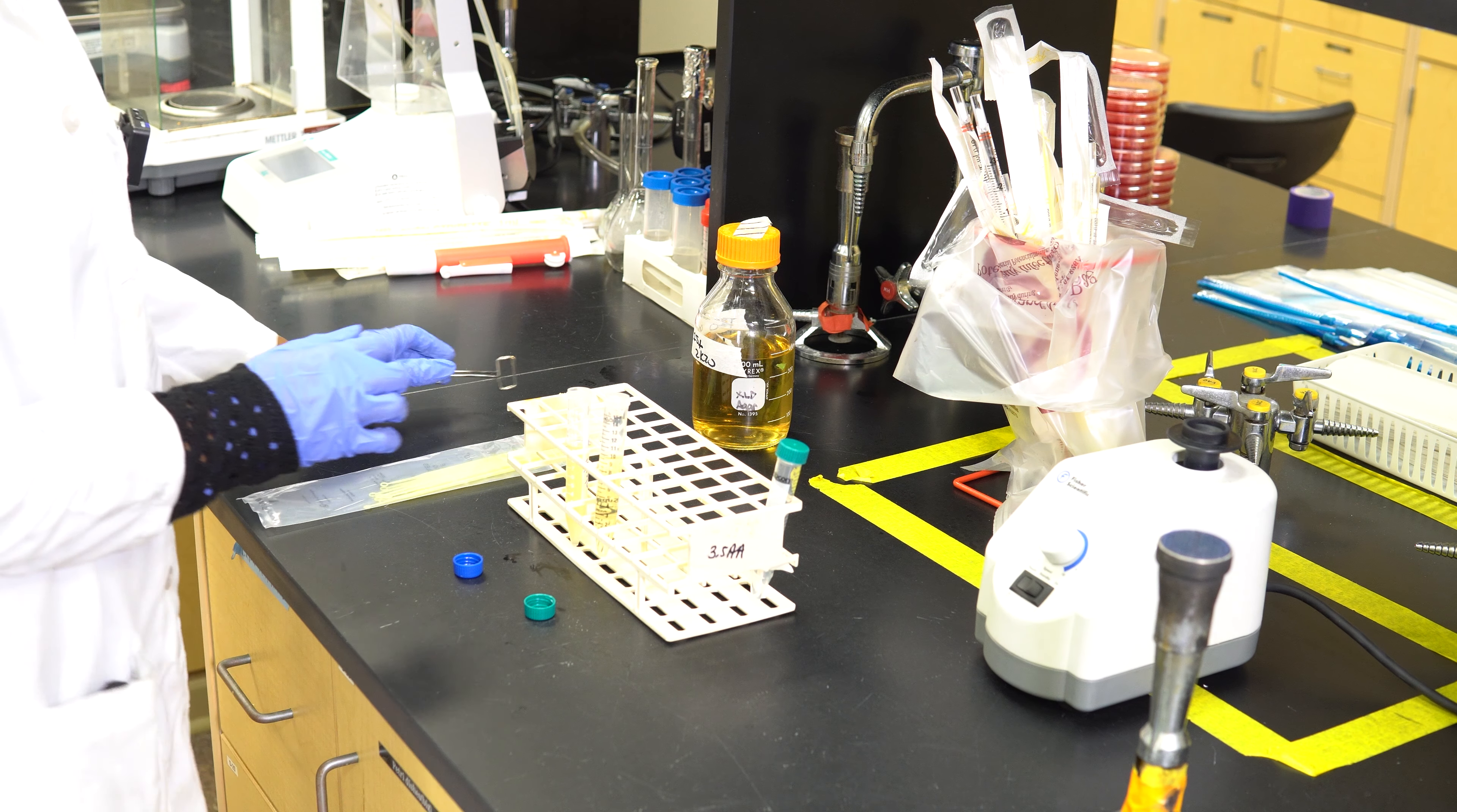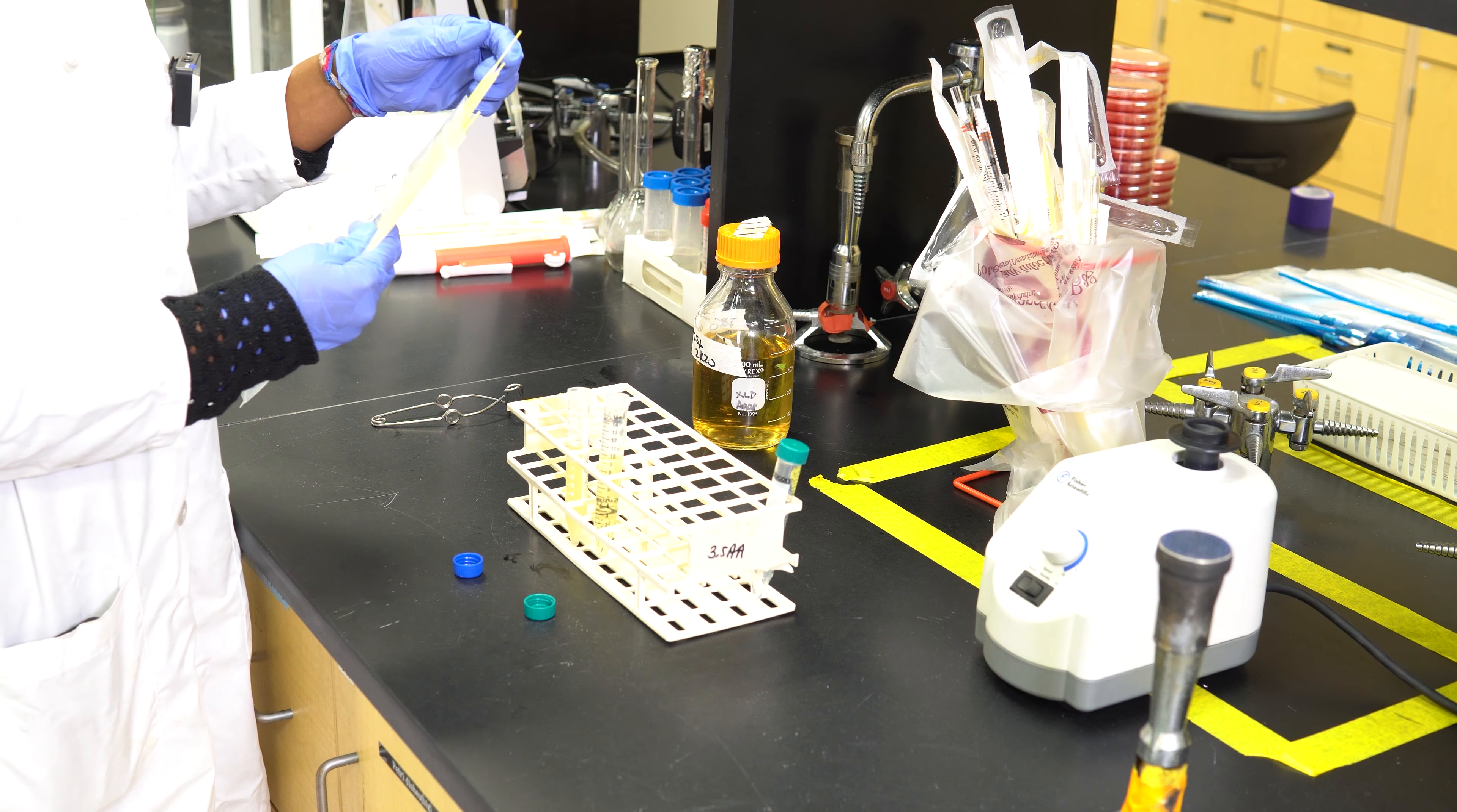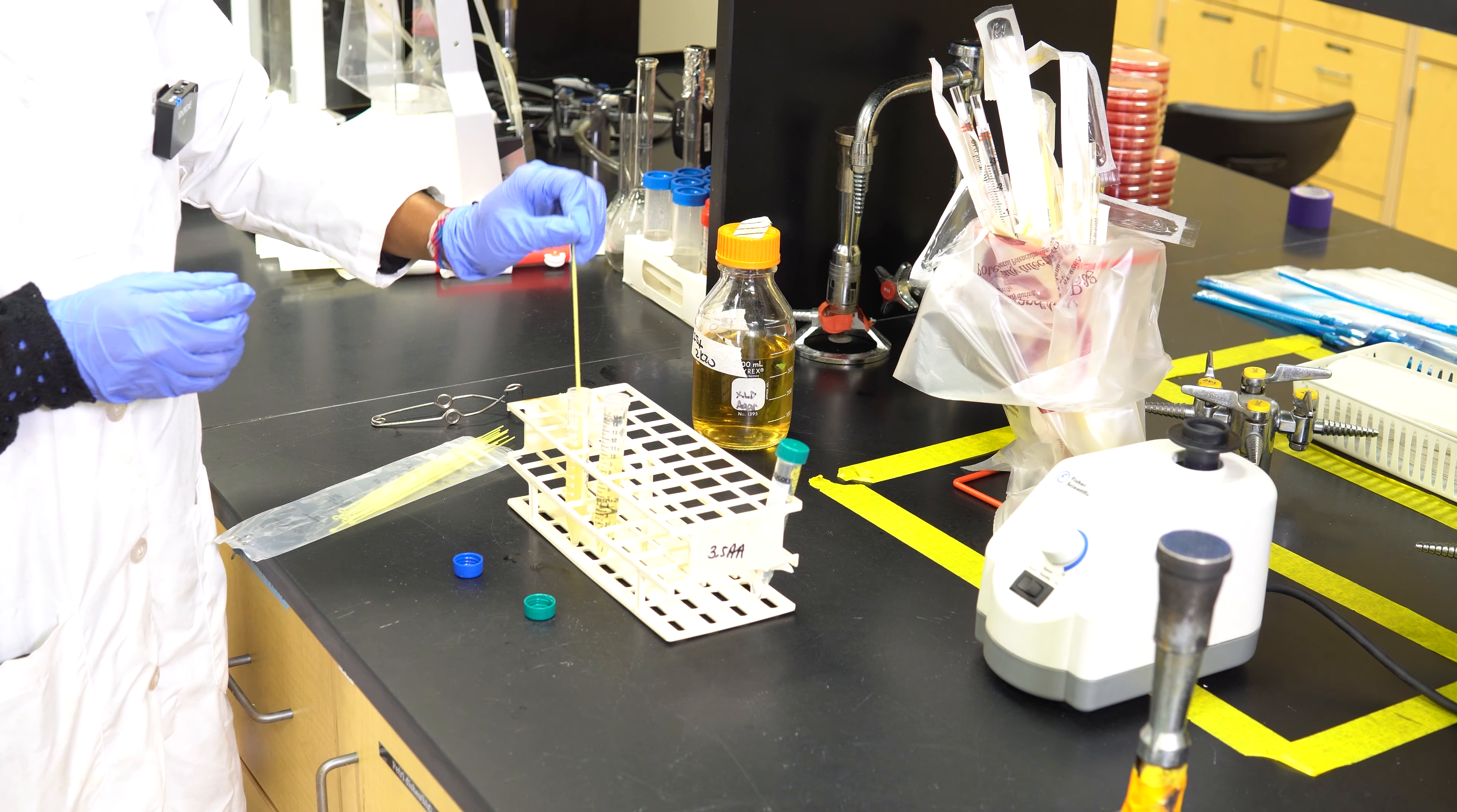The first thing you're going to do is unscrew the top of the microorganism. You're going to do the same for the tube filled with fresh TSB.